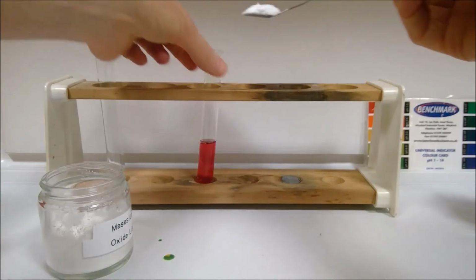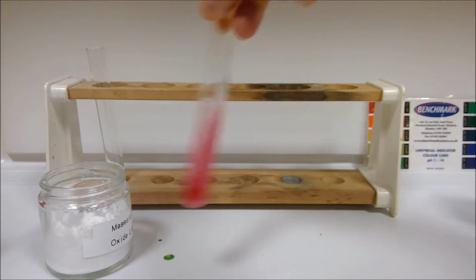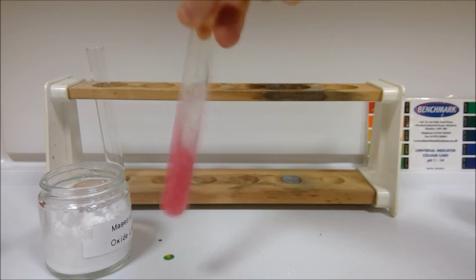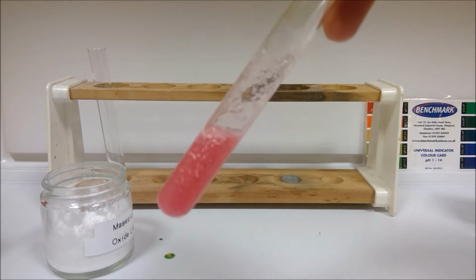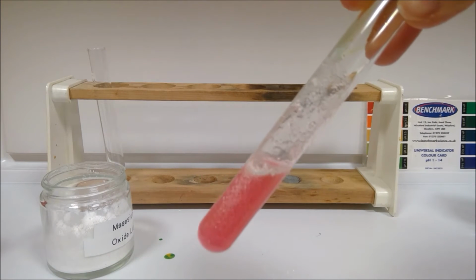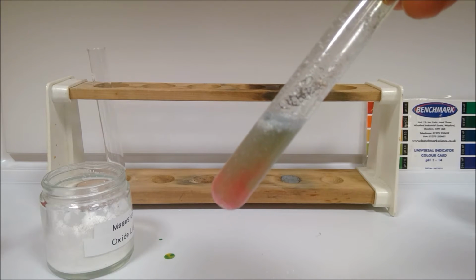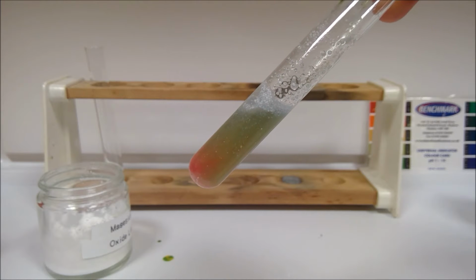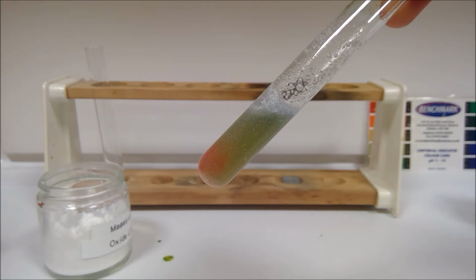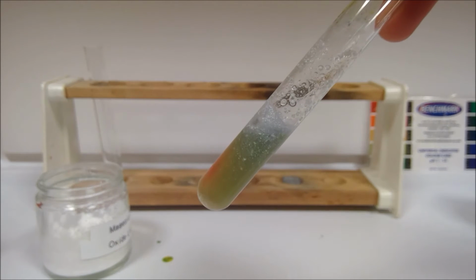So we put a spatula of this in to start with. And shake. So we can't see any change here at the moment. And if you look, we can still, oh, actually no, it's going there now, isn't it? I was going to say we still see quite a lot of solid, indicating that the reaction hasn't taken part completely yet, but it's starting to react away now. So I think we can get away without warming this one.